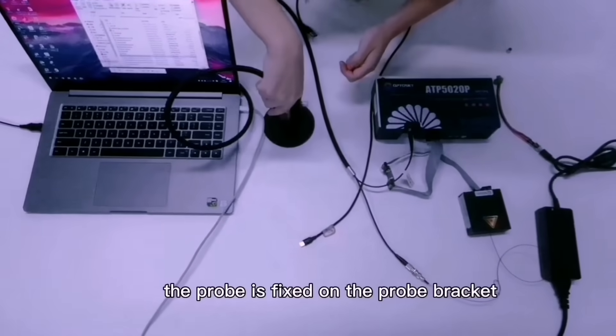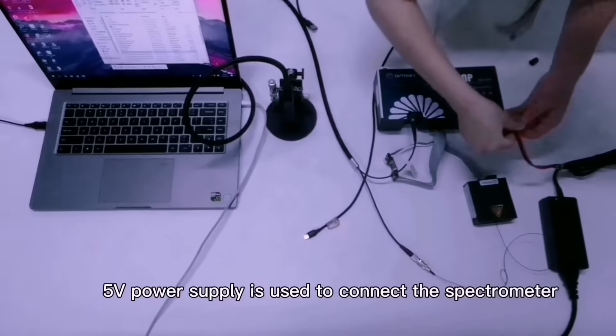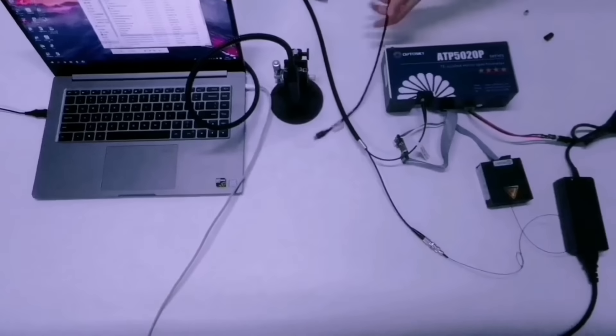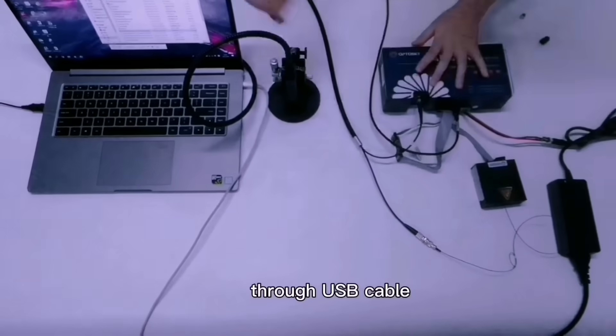The probe is fixed on the probe bracket. The 5V power supply is used to connect the spectrometer, and the computer software is connected through USB cable.